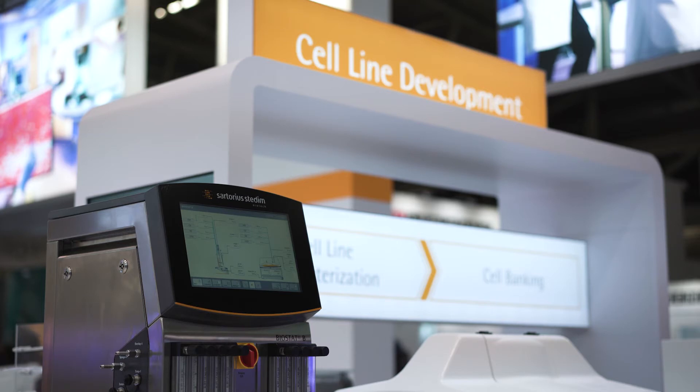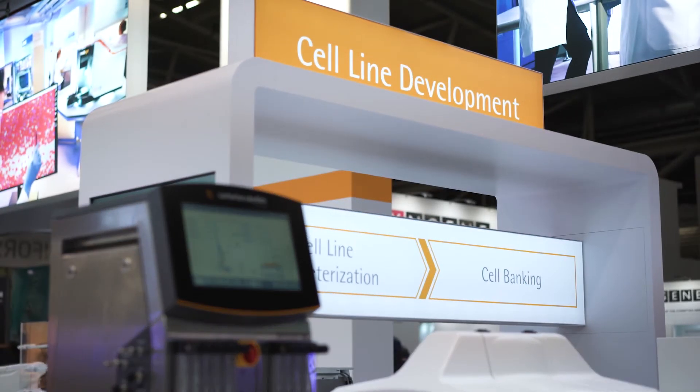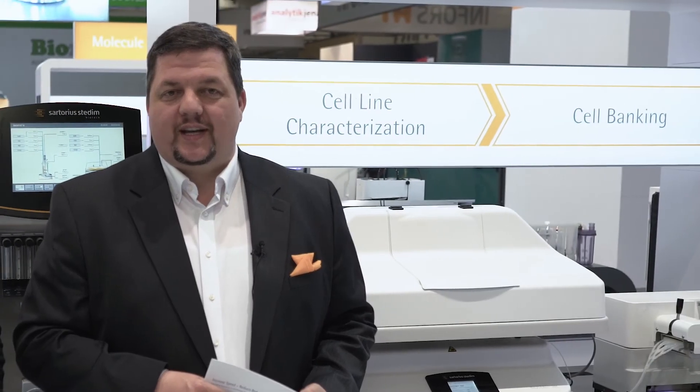Here we are at the last part of cell line development: cell line characterization and cell banking. Hope to see you here as well.